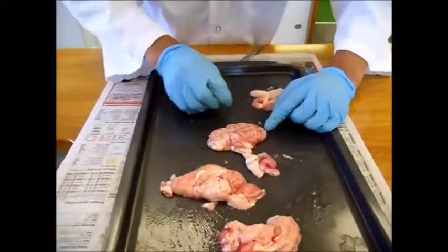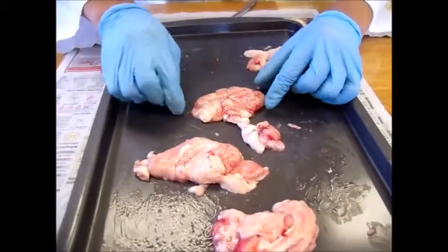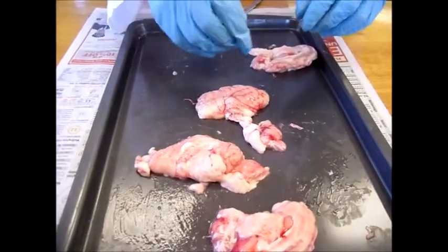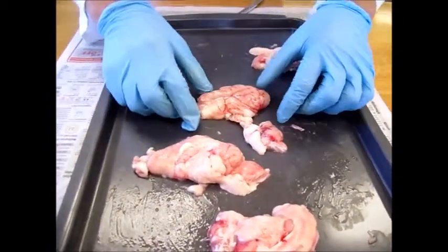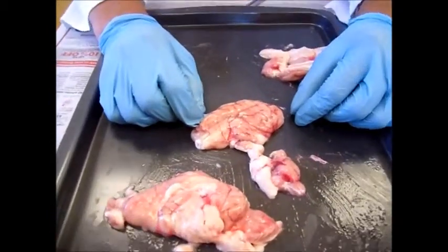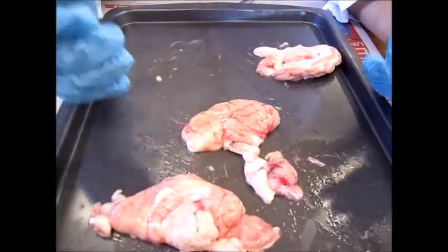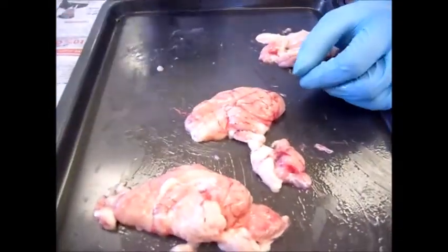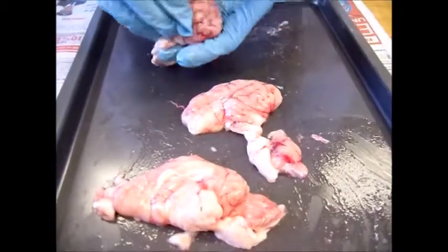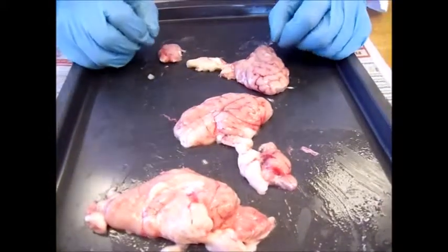So the first part that we will be talking about is the cerebrum, and that is the largest part of the brain. It's also known as part of the forebrain. This whole part is associated with higher order functioning, including the control of voluntary behavior, for example, thinking, perceiving, planning, and understanding language. It's divided into two hemispheres, the left and the right, so since I've cut it in half, you can actually see the two hemispheres.